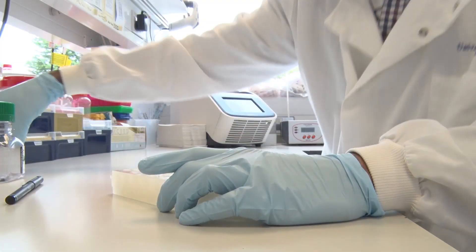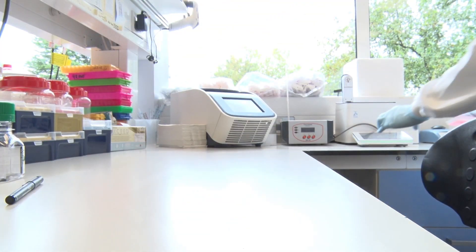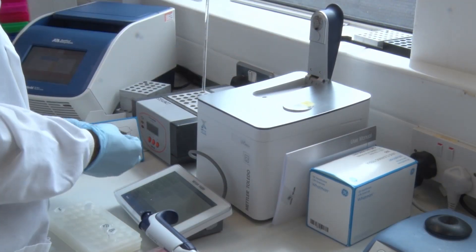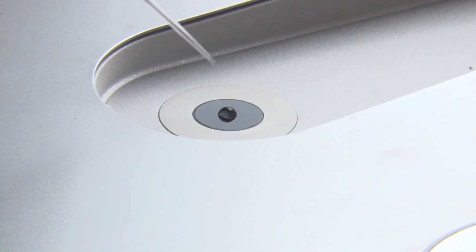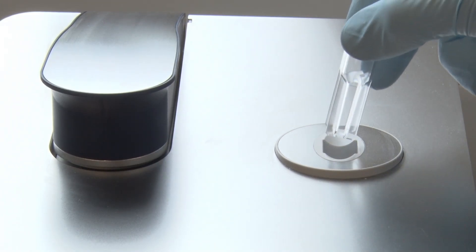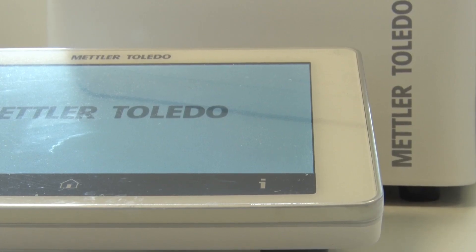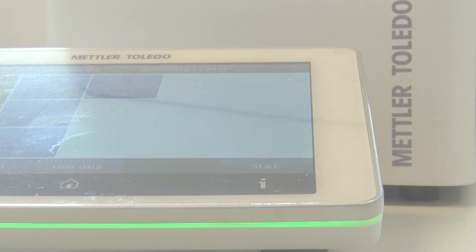It can do far more than we require, but it's always good to have the flexibility — if we need additional functionality in the future, it's already there. We predominantly use the micro volume platform for DNA quantifications and the cuvette for bacterial culture density. It's really good for us to have all of this in one machine.